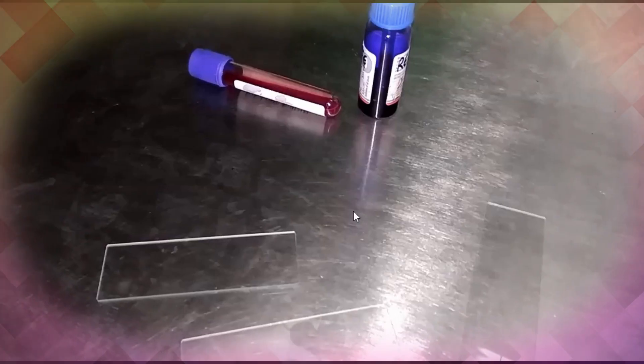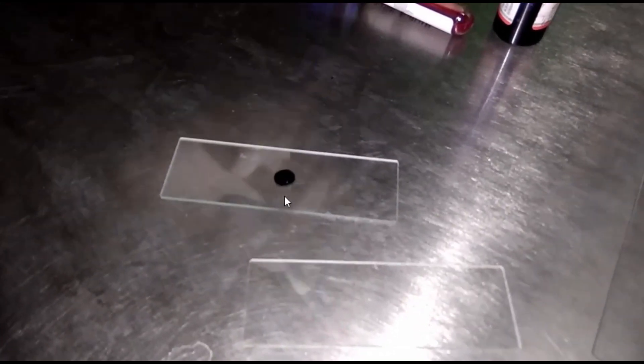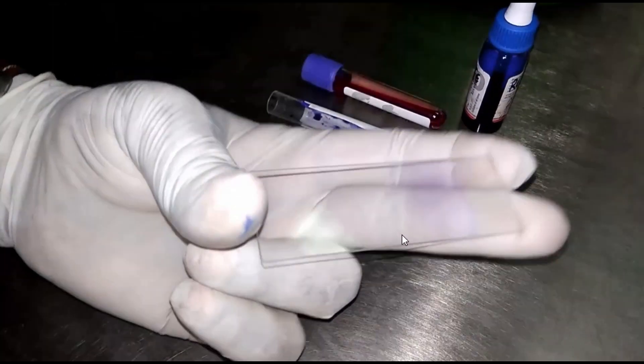Take equal amount of blood and vital stain. Here we have taken 100 microliter blood and 100 microliter methylene blue. Mix properly, then put a drop on this slide and a small drop on this slide, and make a smear in this way.